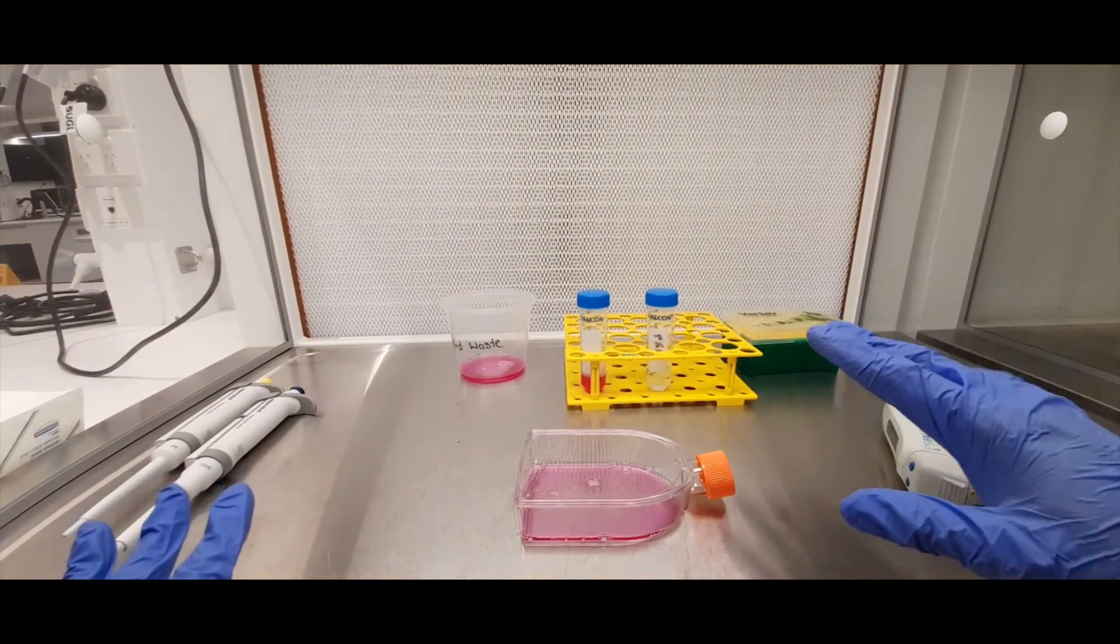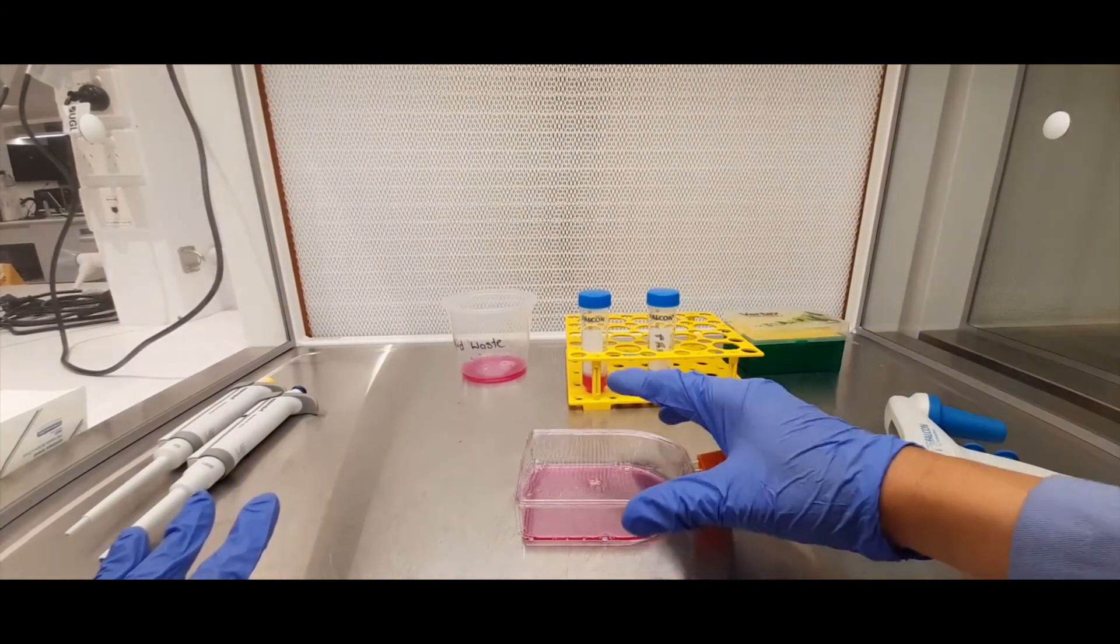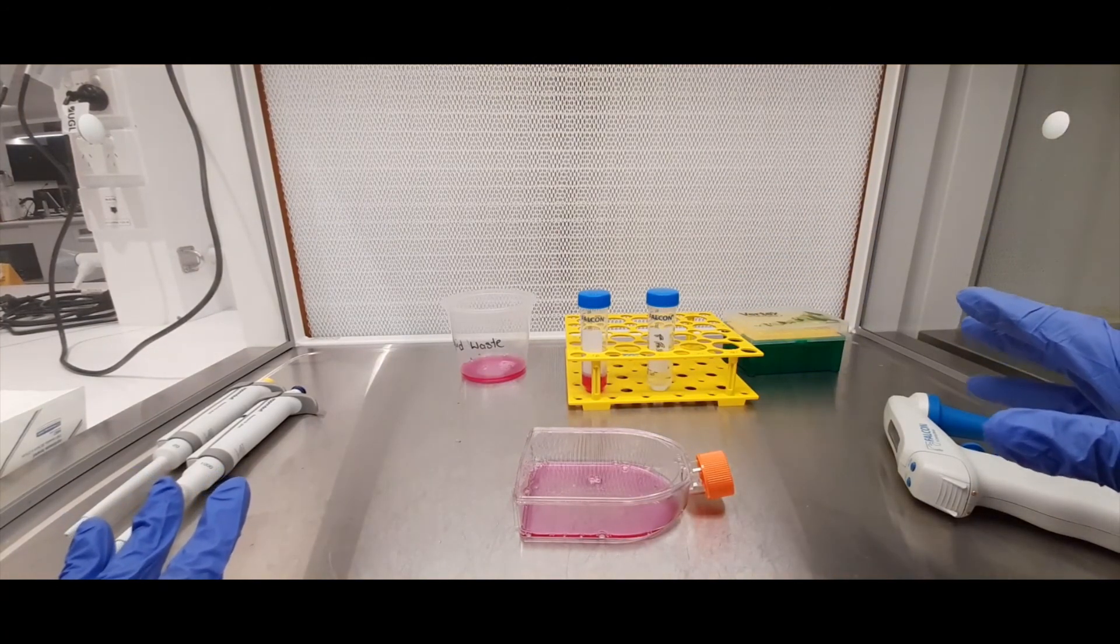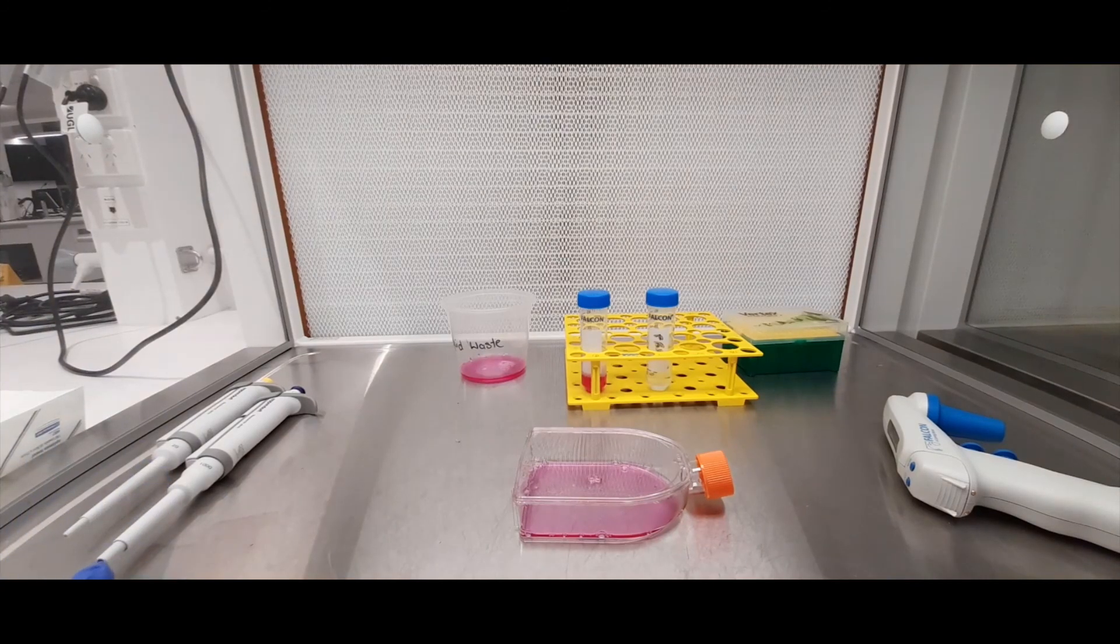So that's how you would transfer liquids in and out of one of these tissue culture flasks in a biosafety cabinet such as this.